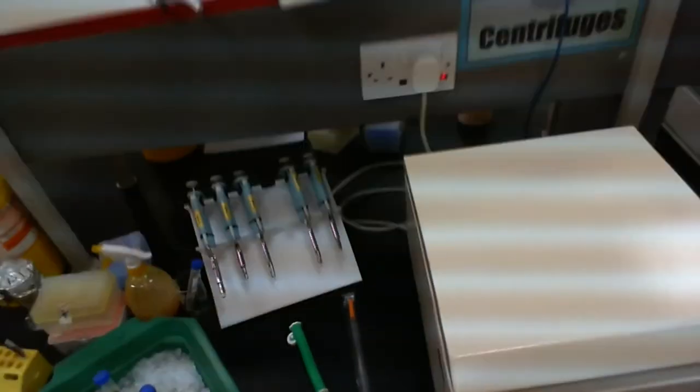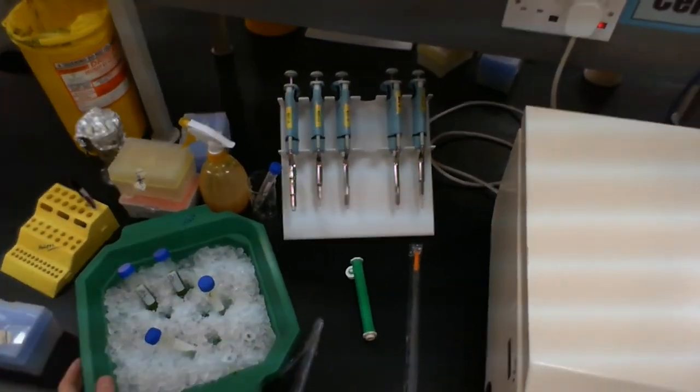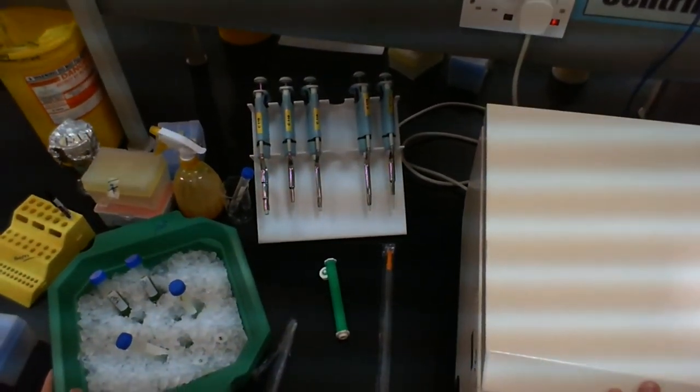So we have our samples ready to go. I'm just going to take these over to the balance, make sure that they are properly balanced. And then we'll spin them down again for about 10 minutes.